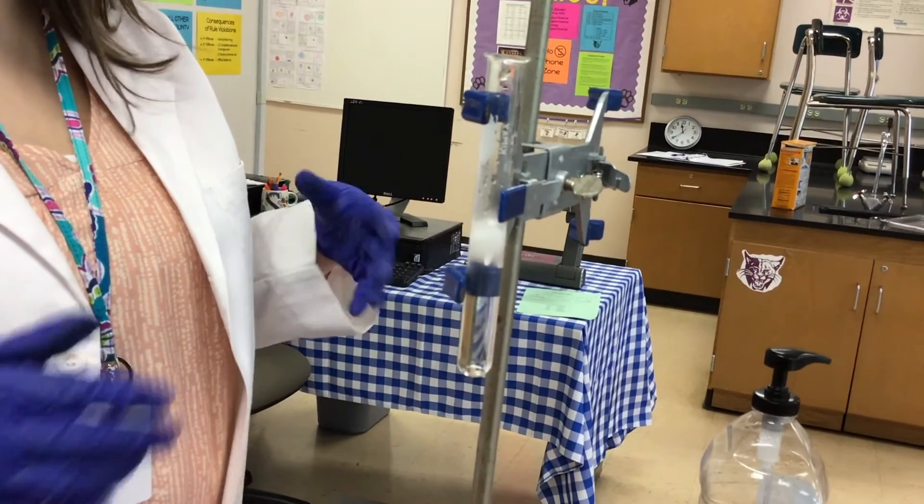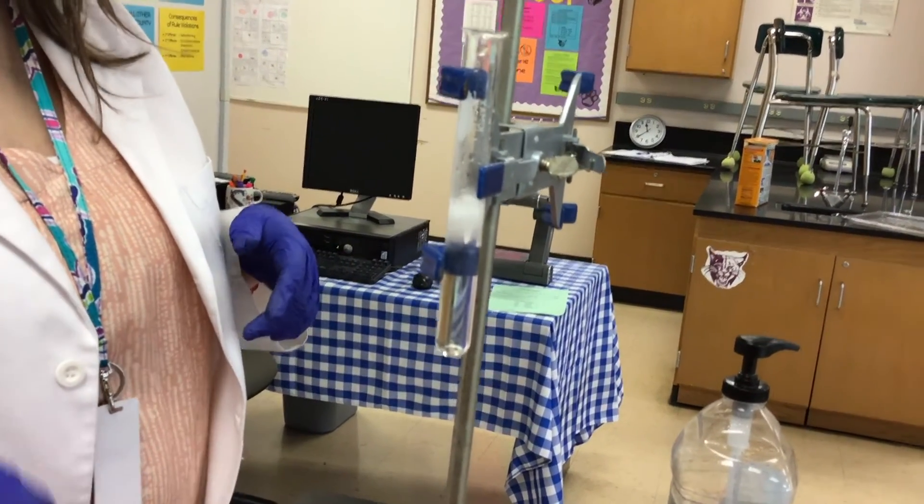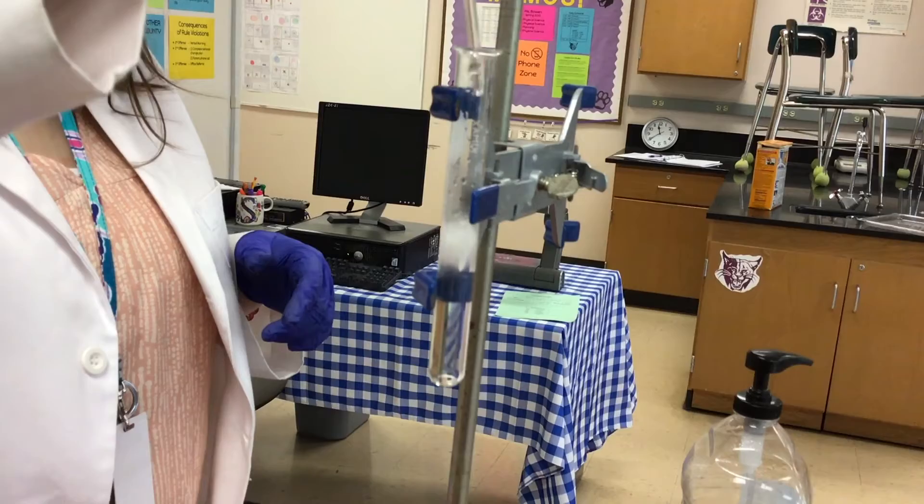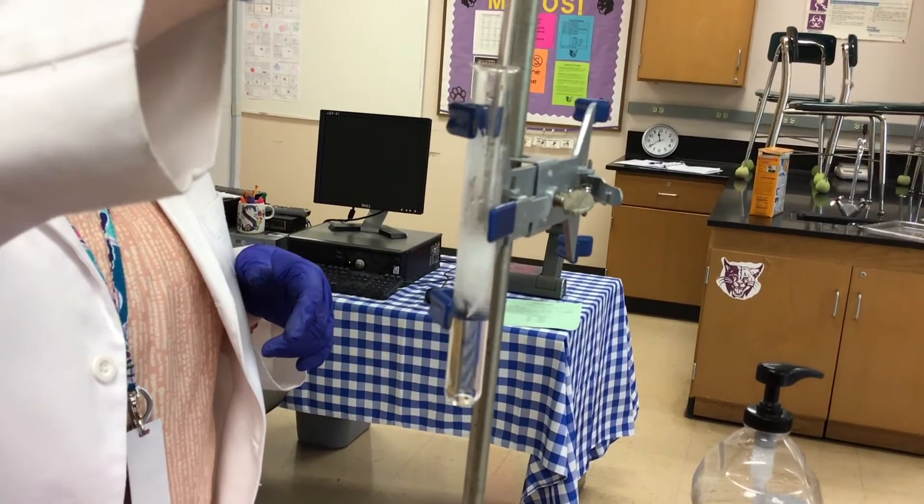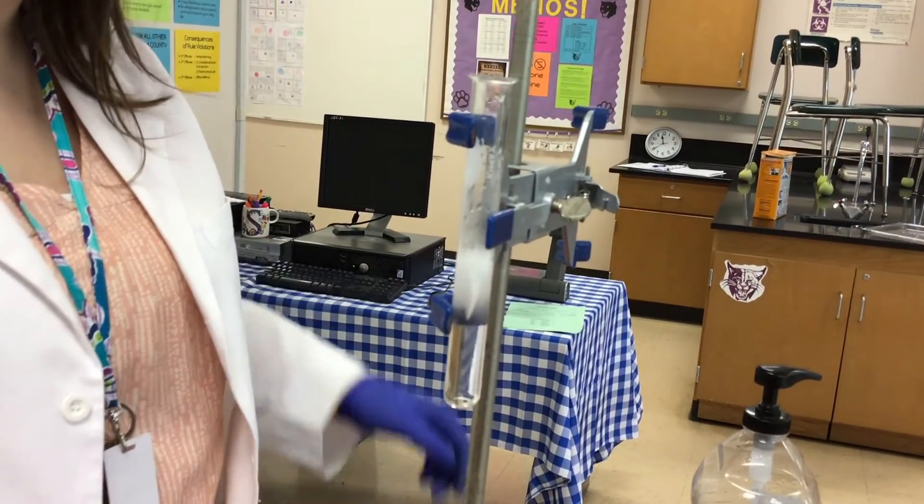You can see our magnesium is going to continue to react with our hydrochloric acid until either all of our magnesium has been used up or all of our acid has been used up.